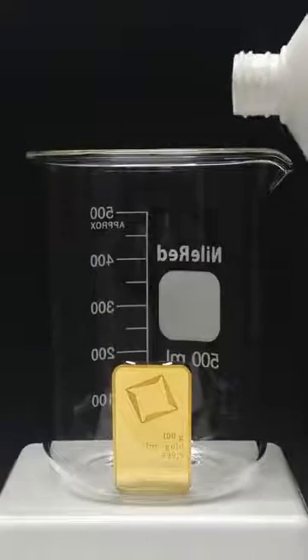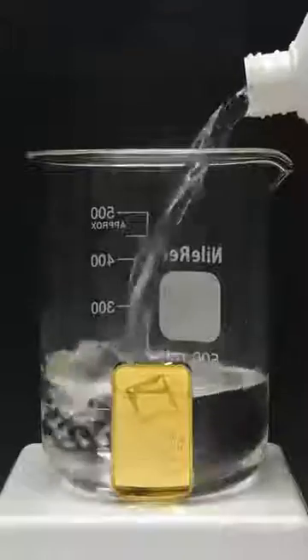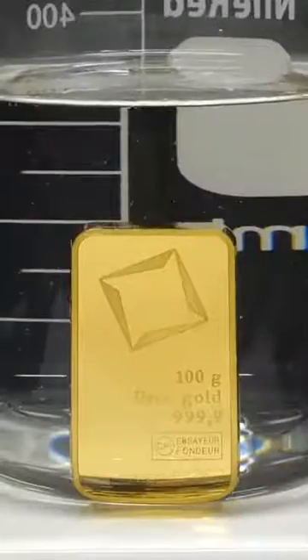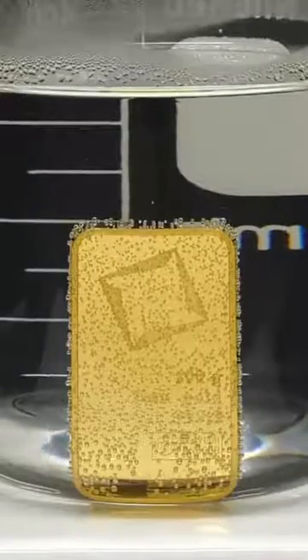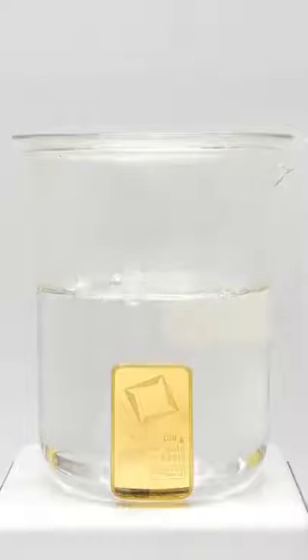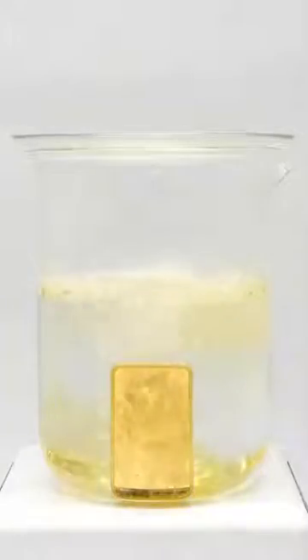All I have to do is pour in a bunch of concentrated hydrochloric acid, and I'll bring this to a boil. Right now, not much is happening, and I have to add some nitric acid. Immediately, the gold starts getting torn apart.